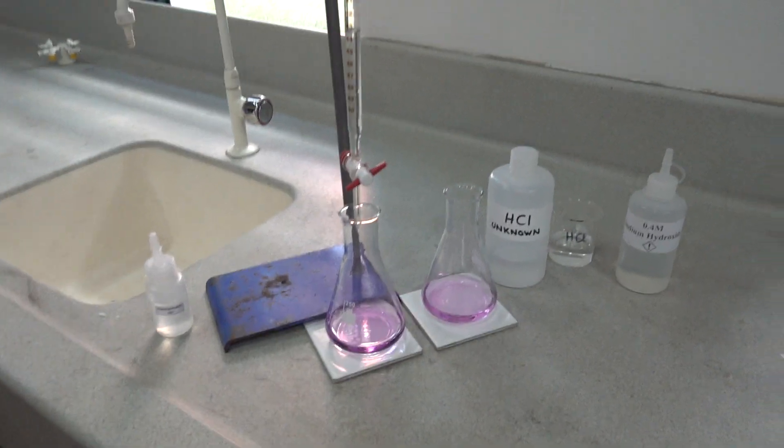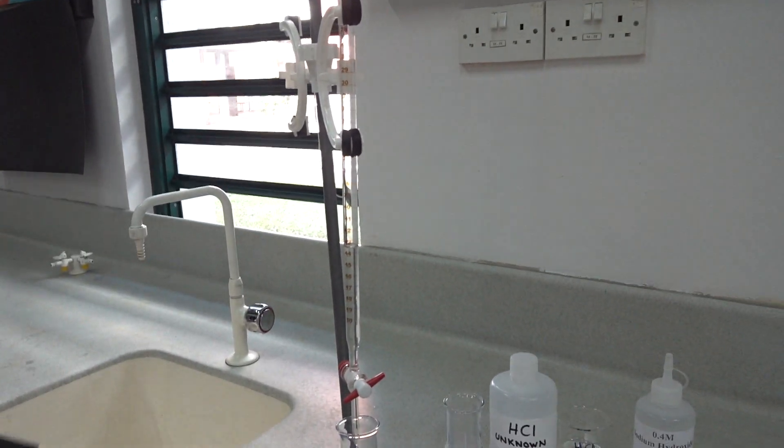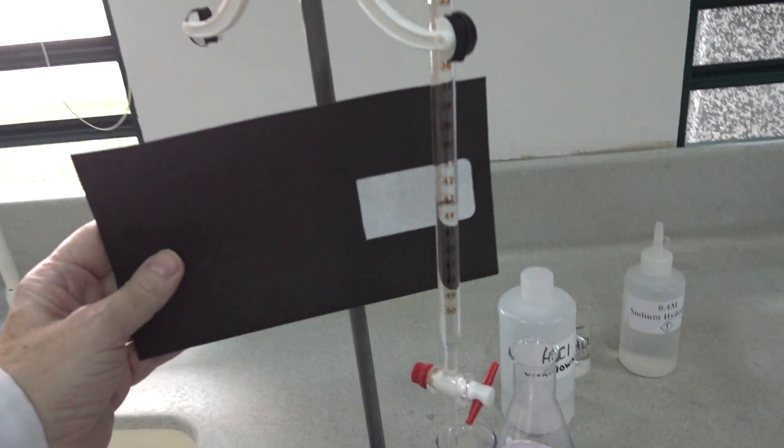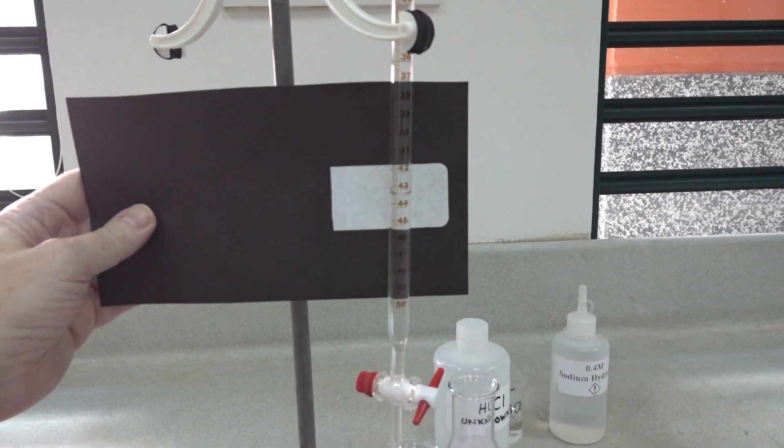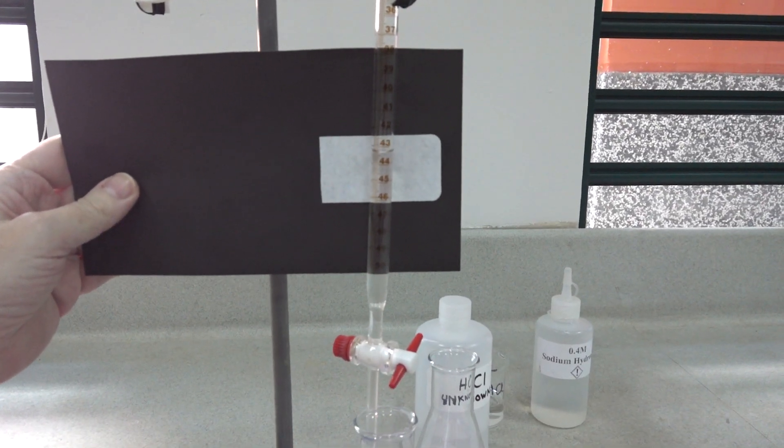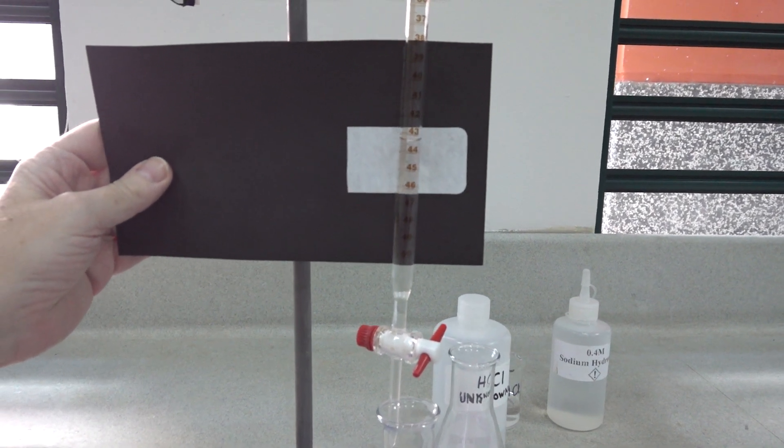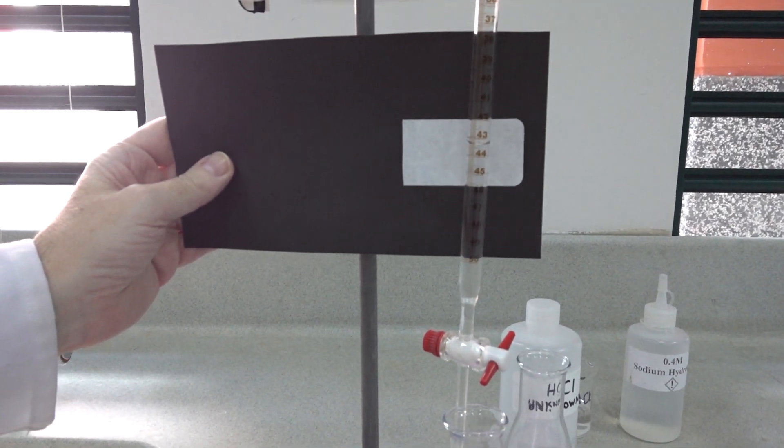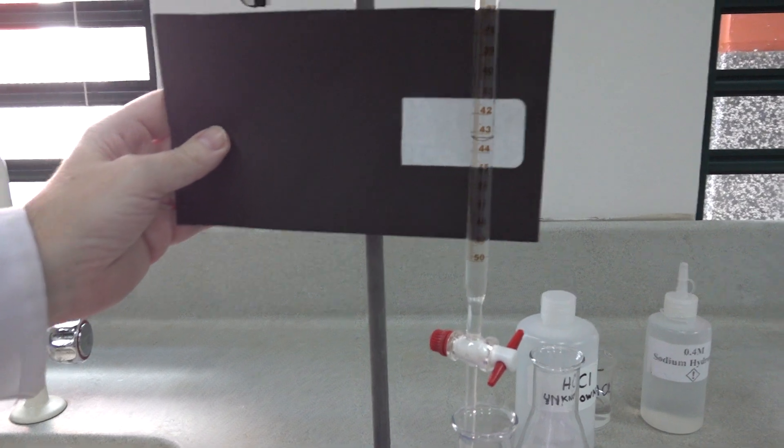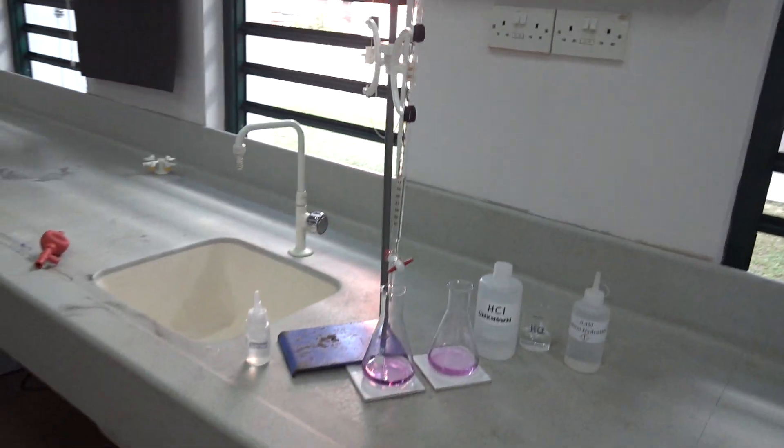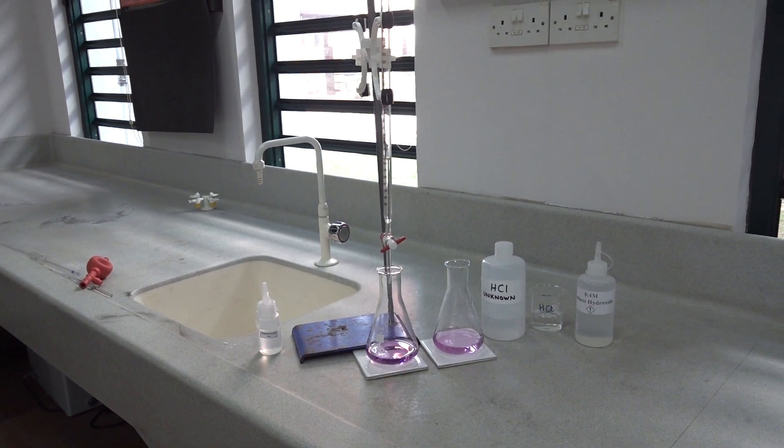That will be seen on the burette reading here. We can read that as 43.4, 43.4 on the burette there. That's a quick revision of an acid-base titration.